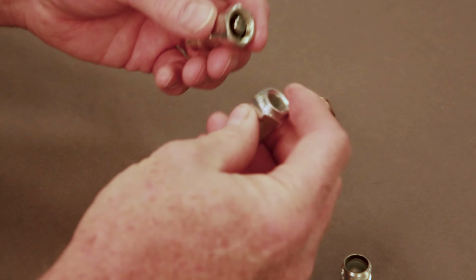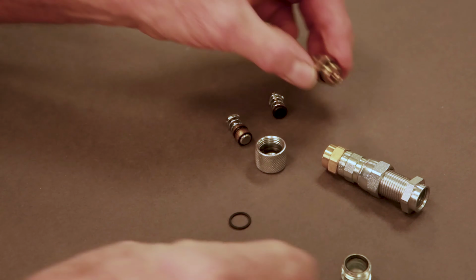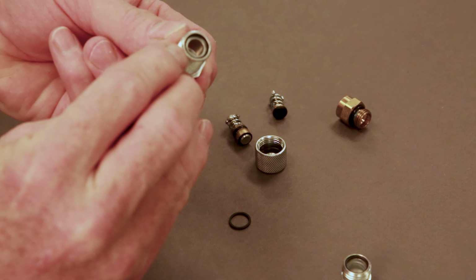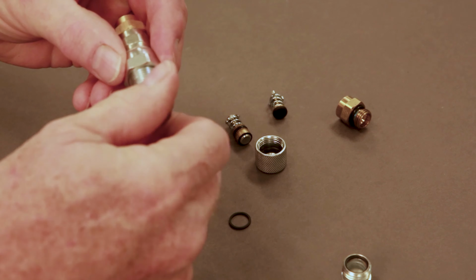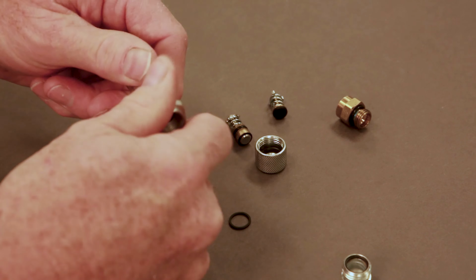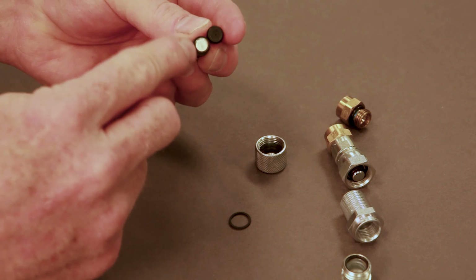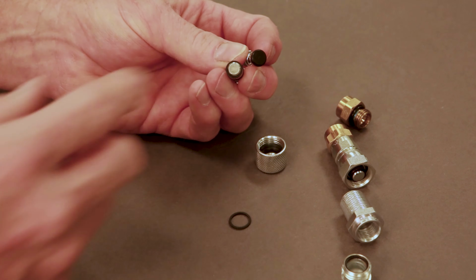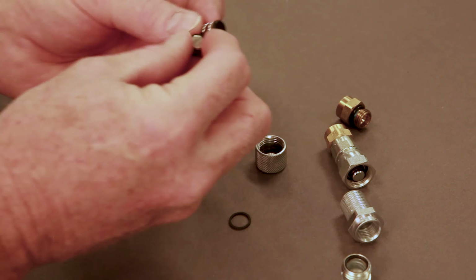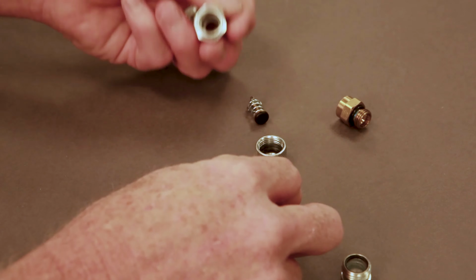So the things that fail on the CryoTigers are seals on these fittings: the O-ring here, the face seal here. And if those fail, they will leak when the connector is mated. If you unmate the connector and hear gas leaking, it's because there is a failure in one of these two fittings, valve assemblies. And in that case, you've got to take the fitting completely apart and repair it with new valve assemblies.